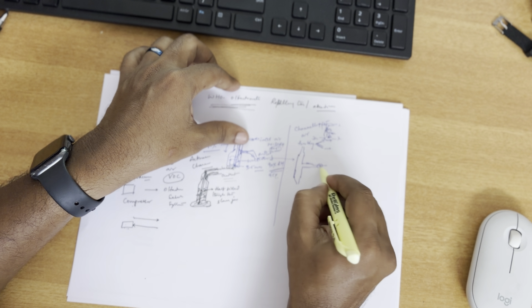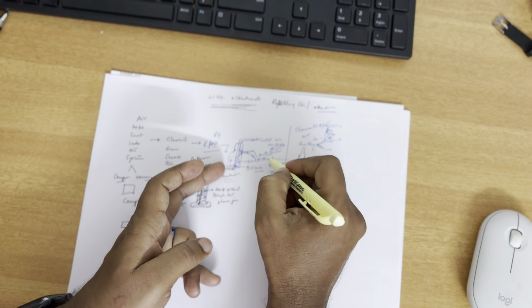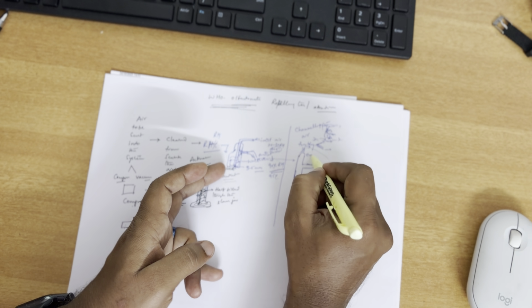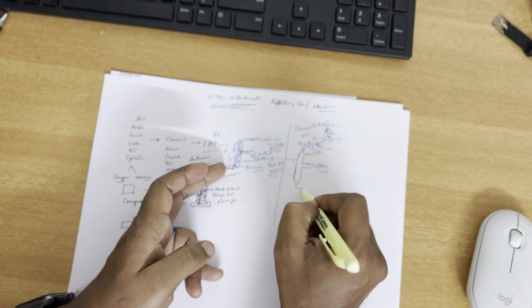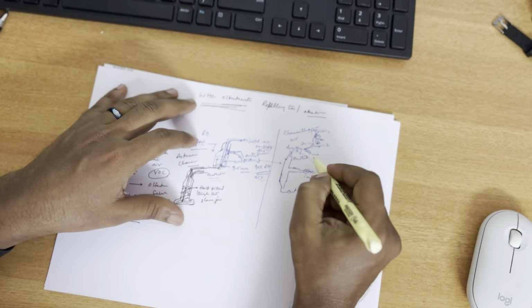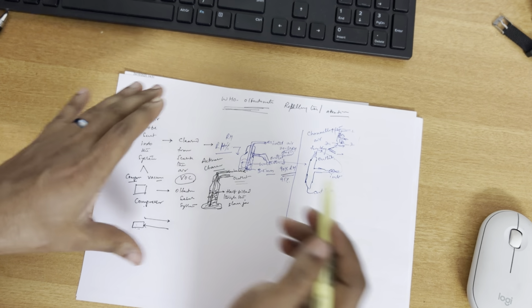So the air we are sending here, inlet. So you just need to imagine like this. So air we are sending from here to inlet. So this is actually the outlet 1. This is outlet 2. From outlet 1 and outlet 2, now you see that the air is being compressed and then sent here.